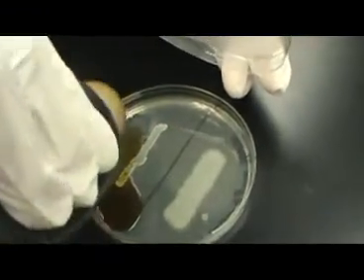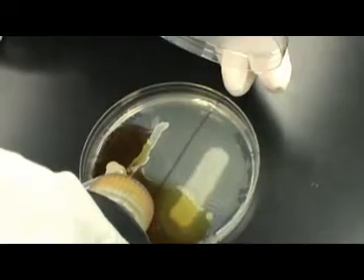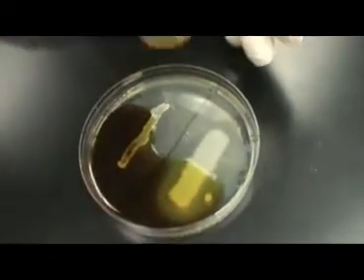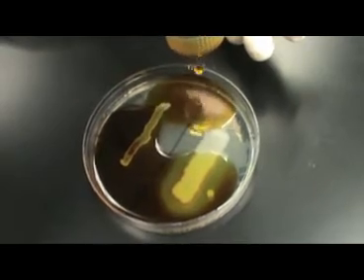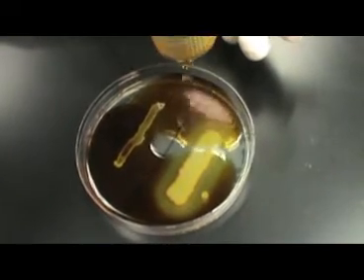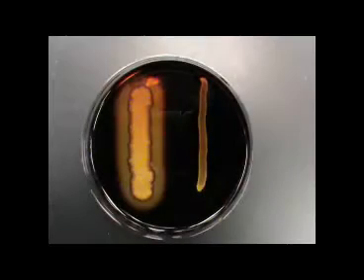The reaction between iodine and starch is immediate. This makes the starch test a very simple one to interpret. After flooding the plate with iodine, it only needs to sit for 30 seconds to 1 minute in order for results to be interpreted. Most of the time, results are visible before you've even completed flooding the plate with iodine.